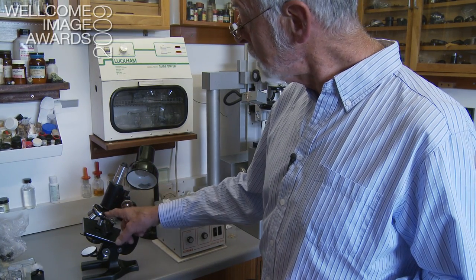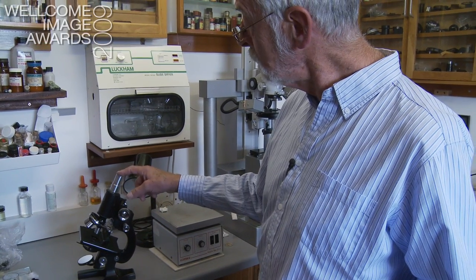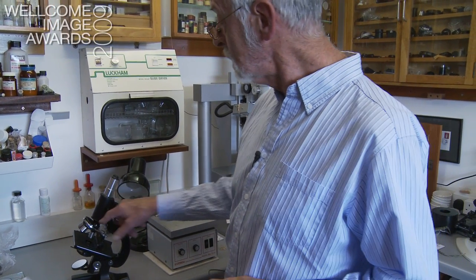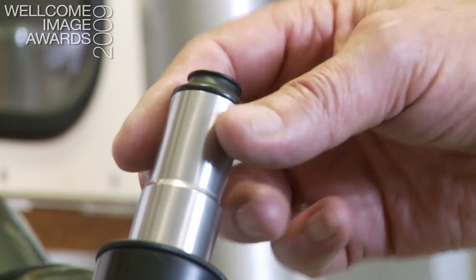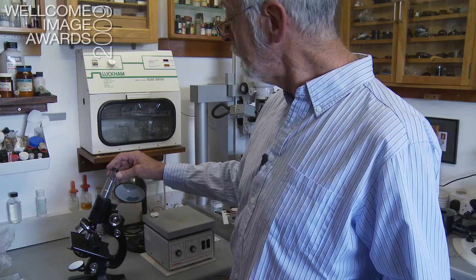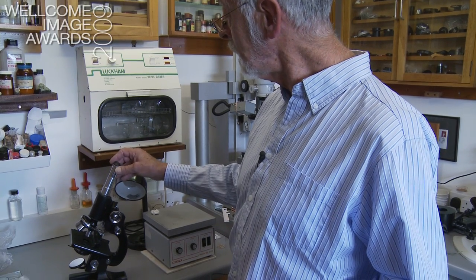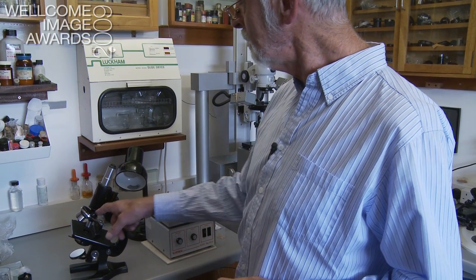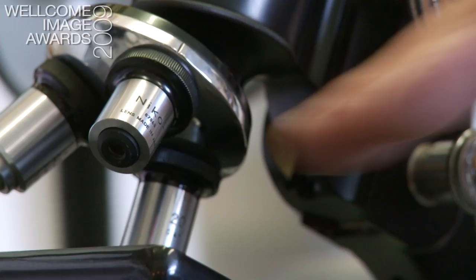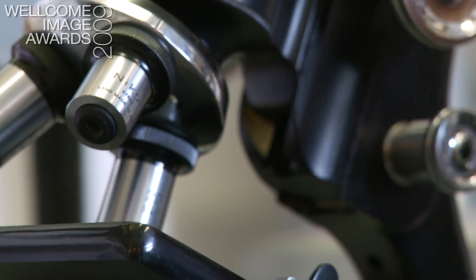Those objectives are on the end of a tube, which traditionally was six inches long. And in the top there's an eyepiece. The eyepiece merely magnifies the image produced by these objectives.